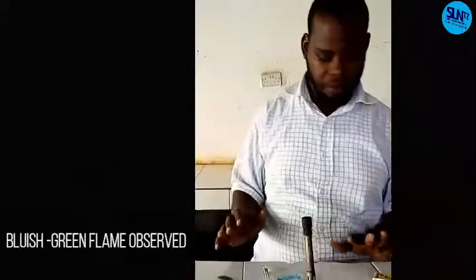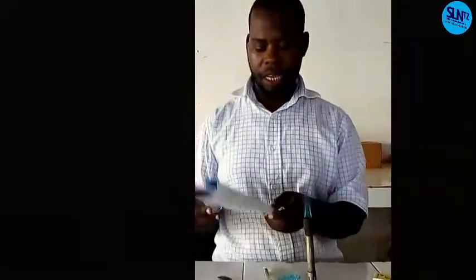So I think you have enjoyed the observation. You can make sense of your observation and your inference. Then you're going to open your sheet on the flame test side. When you open on the experiment, it says: dip a nichrome wire or glass rod or back side of a test tube, we have used both, in concentrated acid, then heat it in a non-luminous flame.